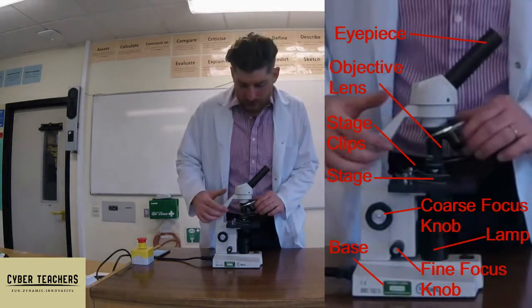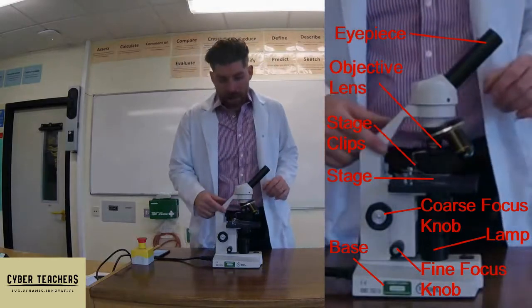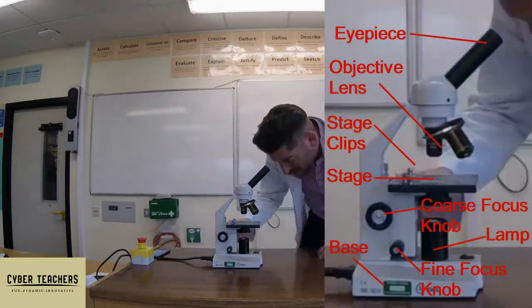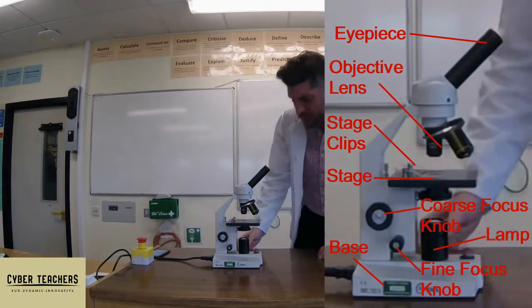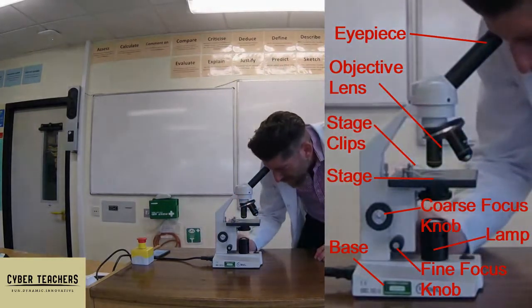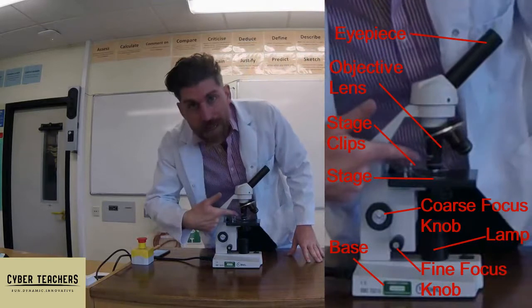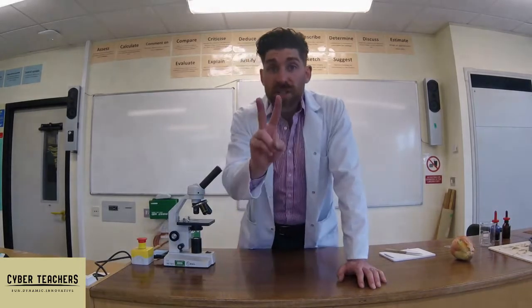To look at something under a microscope, put the specimen on the stage, then turn to the lowest magnification — the smallest lens — and focus it whilst looking through the microscope. Only when it's in focus can you turn to the middle magnification and focus again, then to the highest magnification. Don't start on the highest magnification — if you did, you could drive the objective lens through the specimen, smash the slide, and break the microscope.